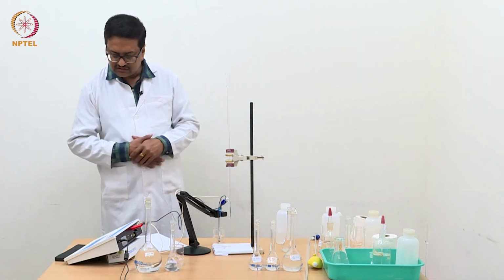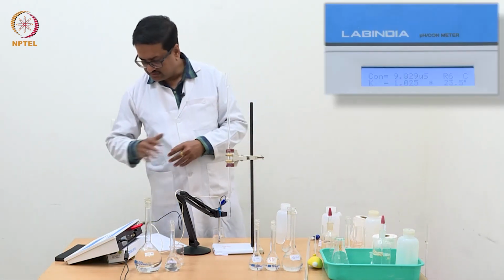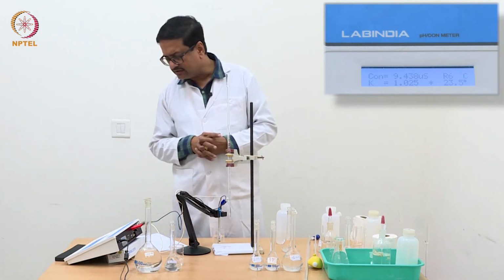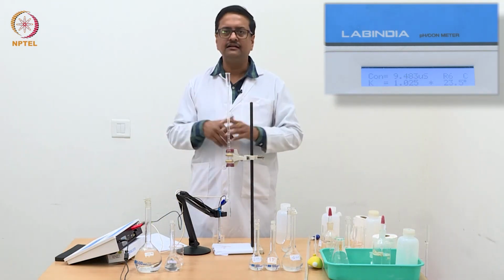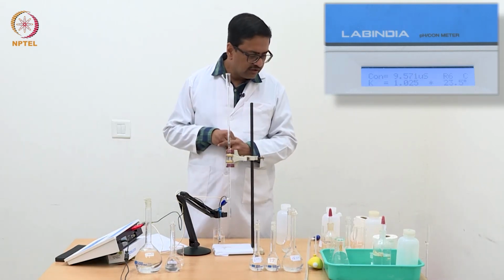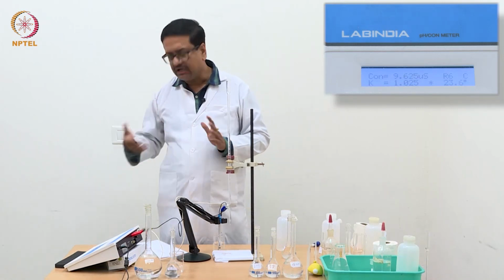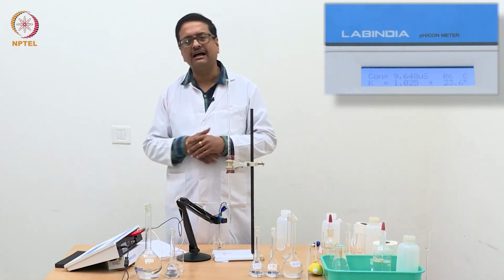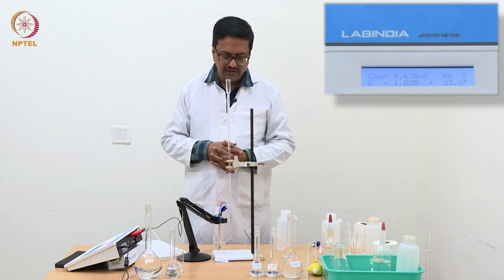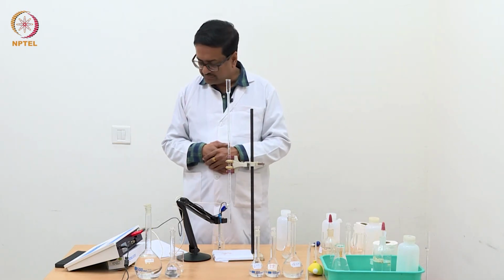So I think this is a point where we need to leave, because it's reading about 8 to 9, 10, it is all right. One can take this electrode to the lab and dip it in a little more ammonium hydroxide solution and remove it. But in my opinion, if it is about 8 to 9, then I think it is fine. So we have completed the experiment of the triple mixture.